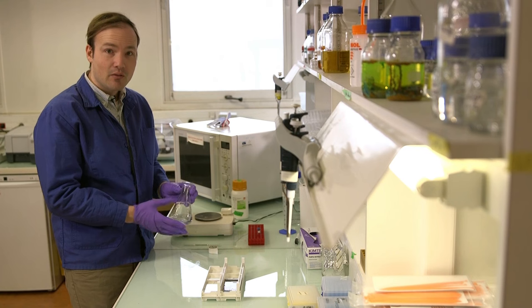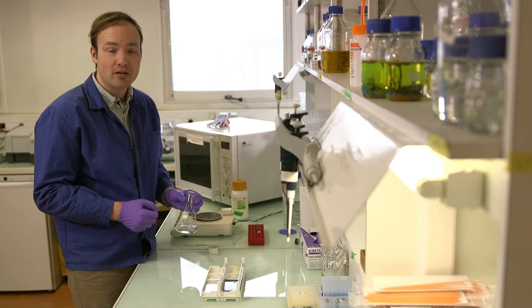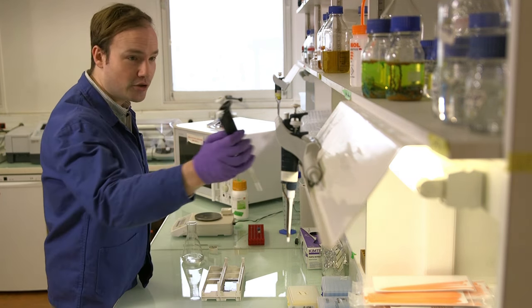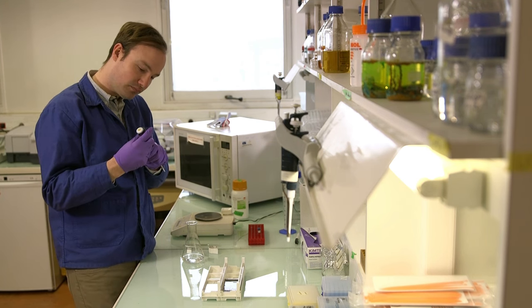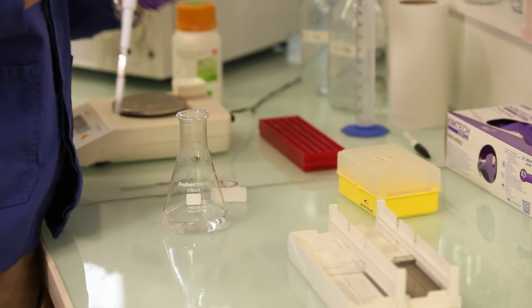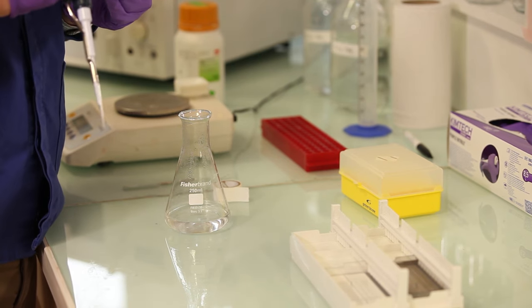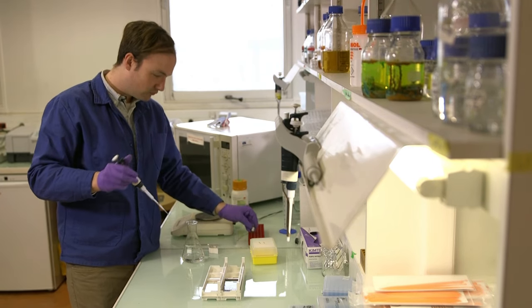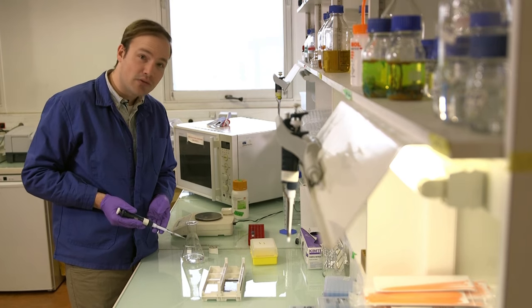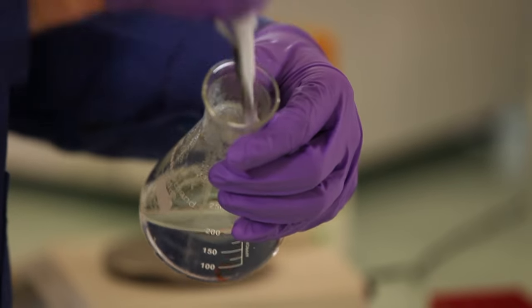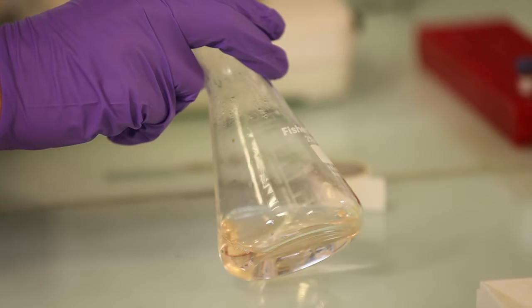Okay. So for this 60 mil gel, I'm going to use six microliters of this DNA stain. It's at a very high concentration. It has this very bright orange color. And then when we add it to our agarose it's going to turn the agarose visibly orange, just a little bit.